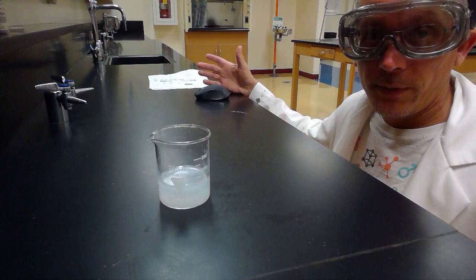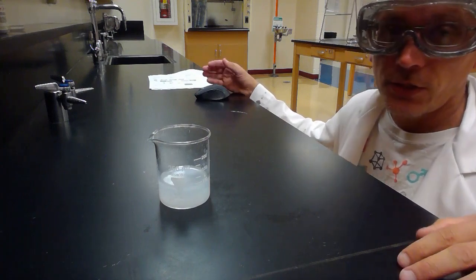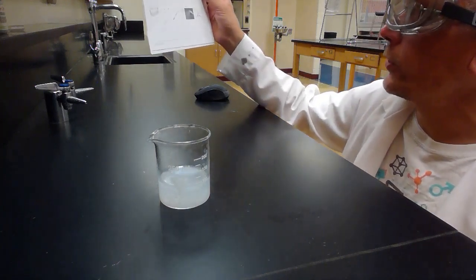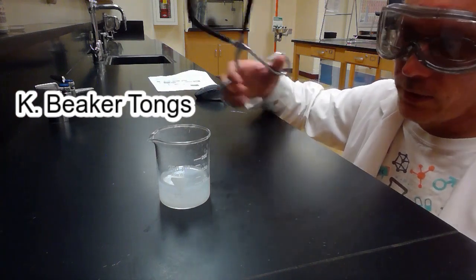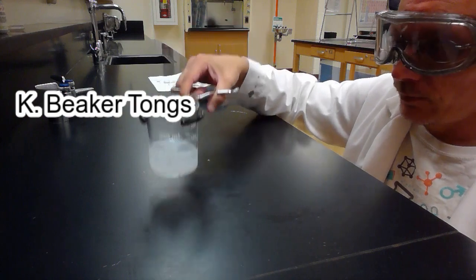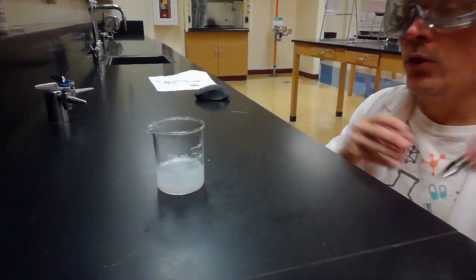Okay, so after heating my beaker, maybe I don't want to touch it because it's hot, but I want to pick it up and move it, so I'm going to use picture K. Picture K is what's called the beaker tongs. We can use the beaker tongs to pick up a beaker when it's hot. Picture K, the beaker tongs.